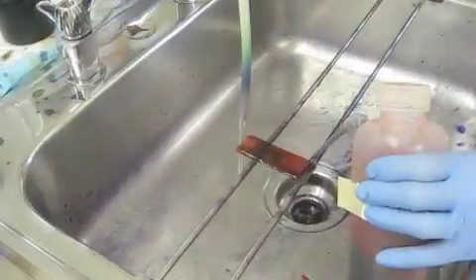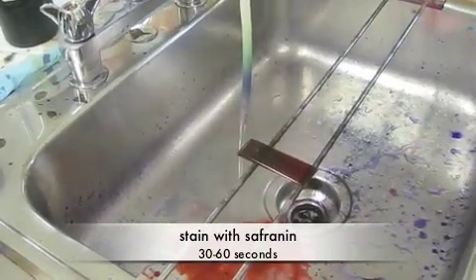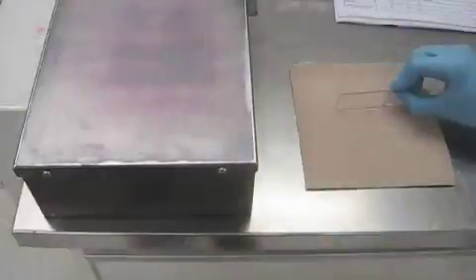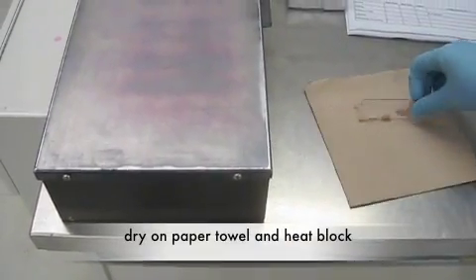Safranin counterstain will turn gram-negative bacteria pink. A final wash, gently blot dry, and allow it to dry on a heat block.